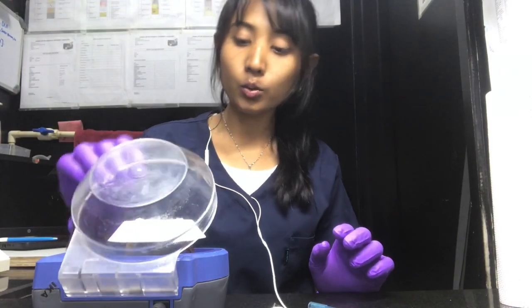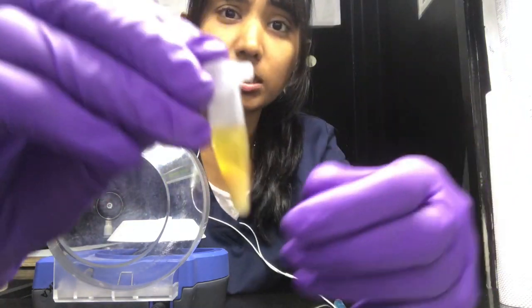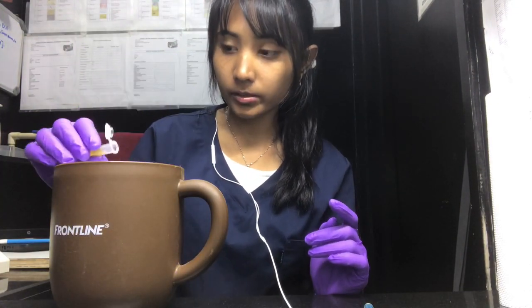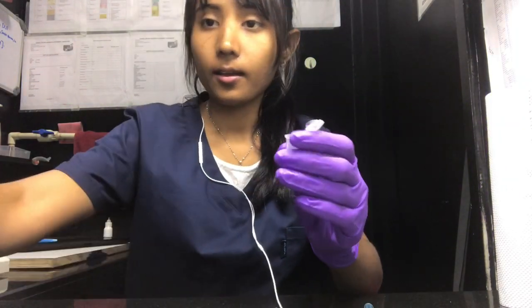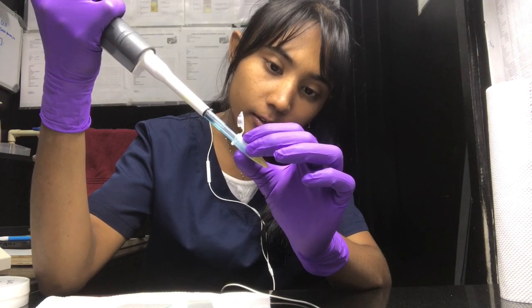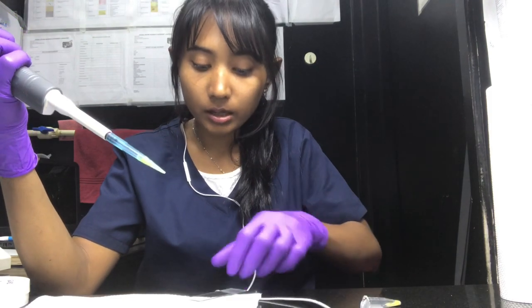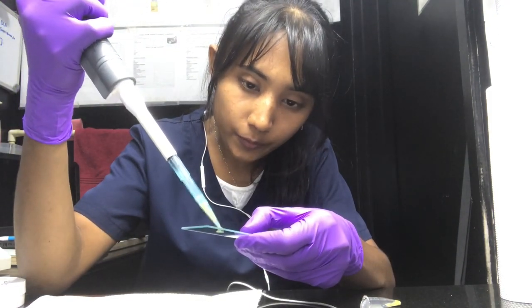Centrifugation is over, and yes this is very turbid. I'm going to discard the supernatant and we are left with the sediment. I have a glass slide and I'm going to put a drop of the sediment on it.